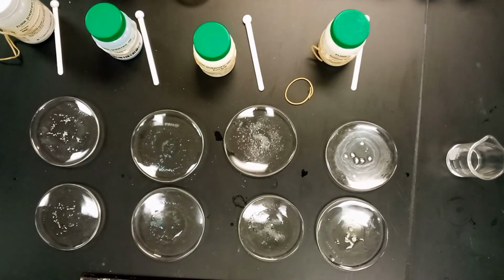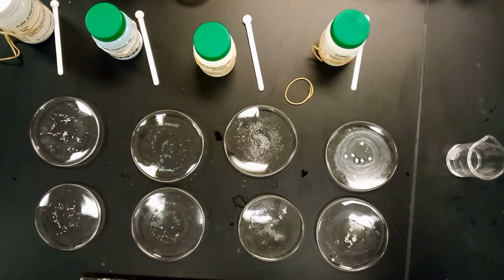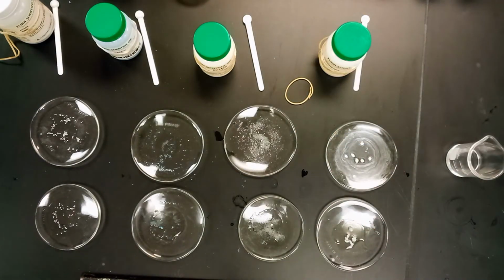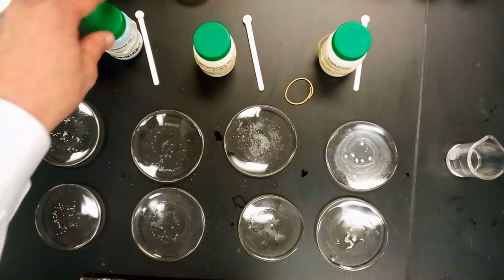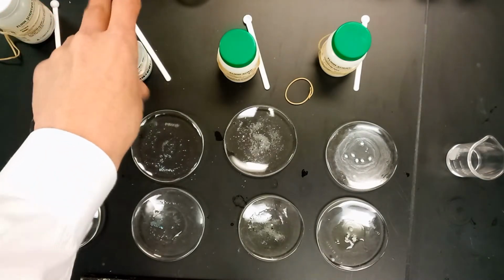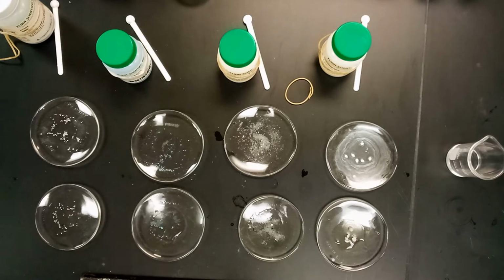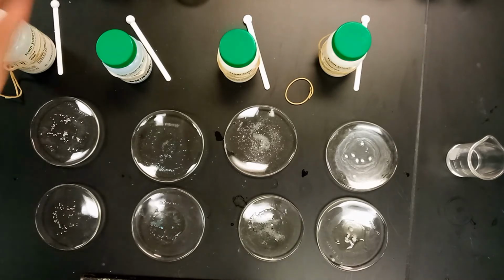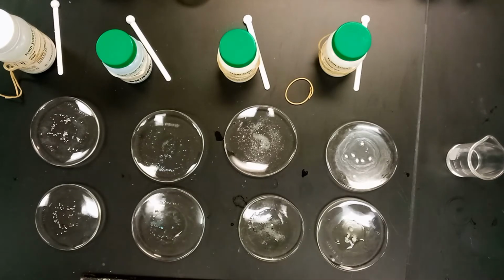There's also some other attributes about each of these to know. For instance, all of them have a melting point above 100 degrees Celsius, except for paraffin wax, which melts lower than that. Additionally, of the two that go into solution, the copper sulfate and the dextrose, only the copper sulfate conducts as a solution, and only the zinc conducts as a solid. So that's just some other information to know about each of these and to help us figure out what these 12 items are later on, based on how their bonds are formed.